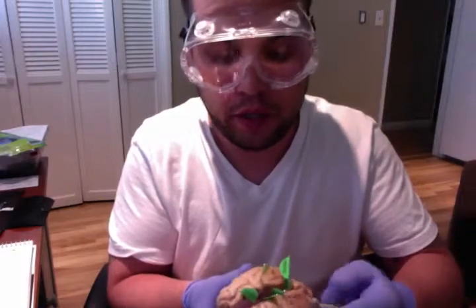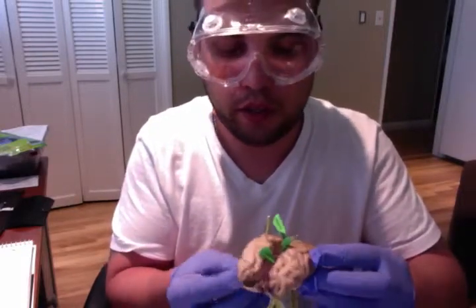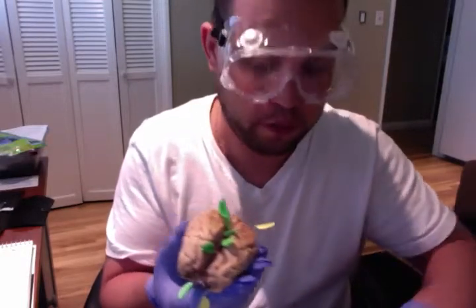Hello, my name is Michael Jaluli, and as part of my anatomy course, I am to create a video indicating different regions of the sheep brain and also describing the function of each region of the brain.